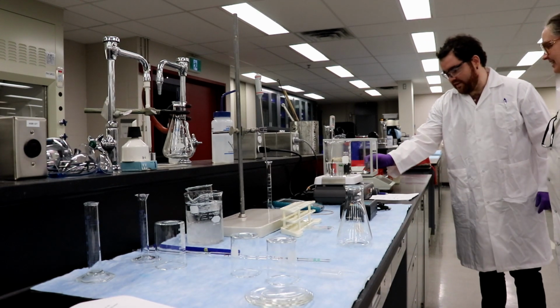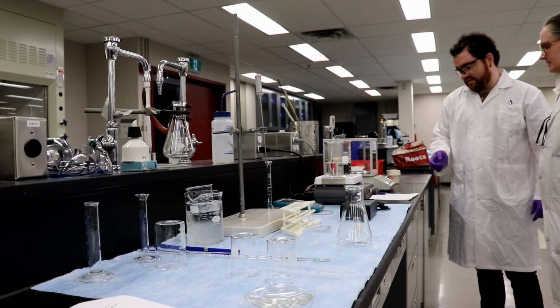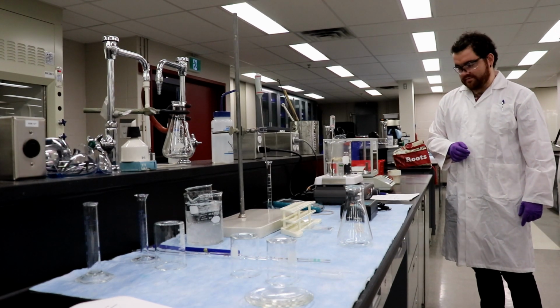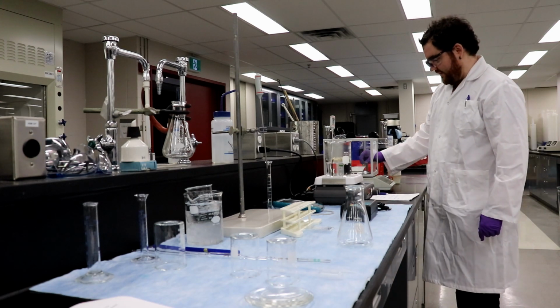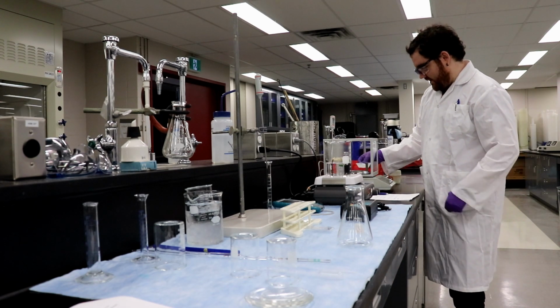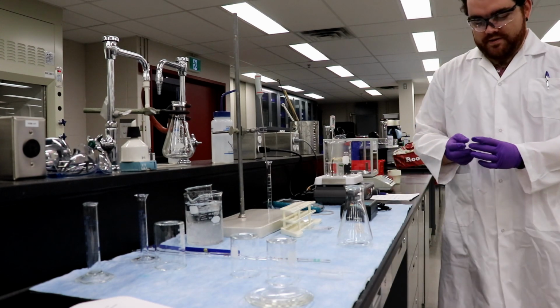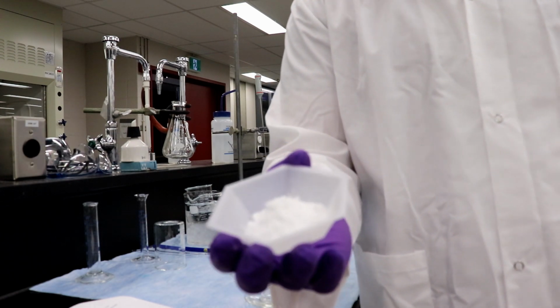Okay, hold on, let me close that. It's going down a little bit when you start walking. There we go, 5.0001. That's impressive. You win. I win. Okay, so 5 grams on the dot. I'll show you guys what that looks like, because it's a whole hell of a lot.